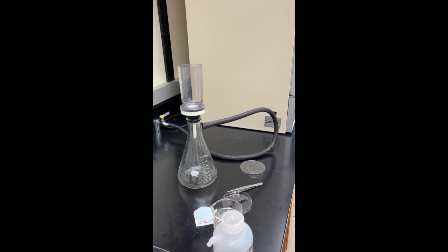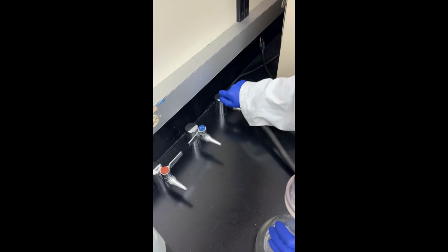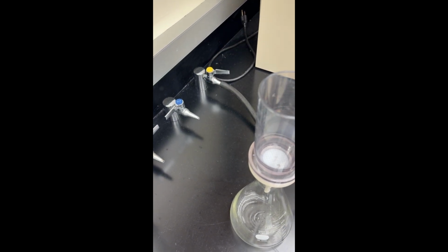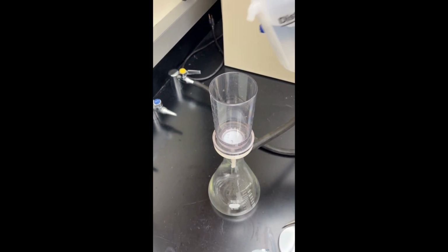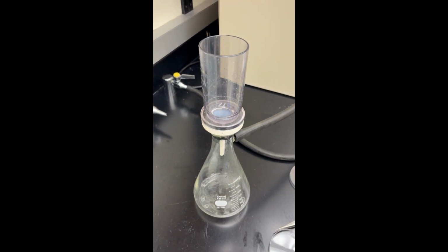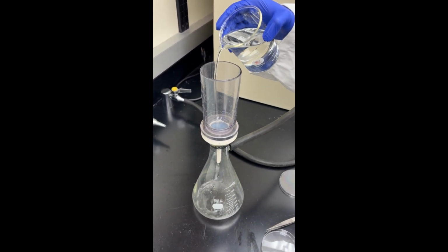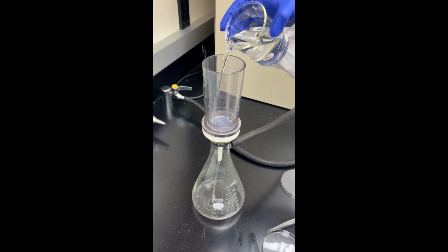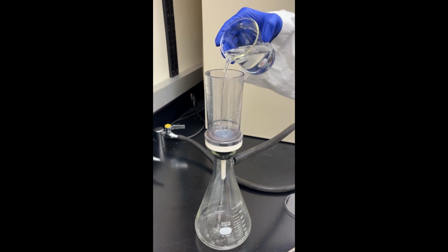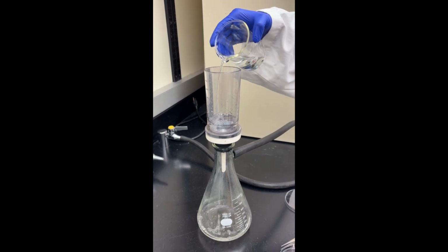All right, now the next thing I do is make sure that my vacuum is working. When I turn on my actual gas line, I should hear a very slight buzzing, which I'm not sure if you can catch on camera. Then I rinse my filter paper out with DI water first. Make sure that the water is dripping down. Then I take my actual water sample and pass it through very slowly, taking little breaks in between to make sure the vacuum is working. If I were to just dump my entire water sample here, it would end up getting clogged, and then I'd have to wait even longer.